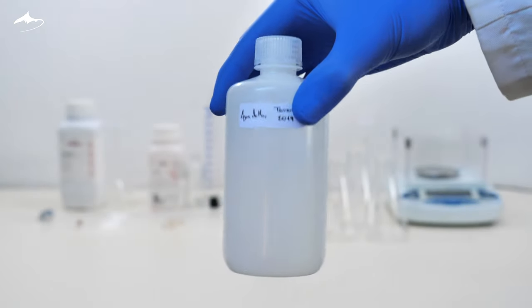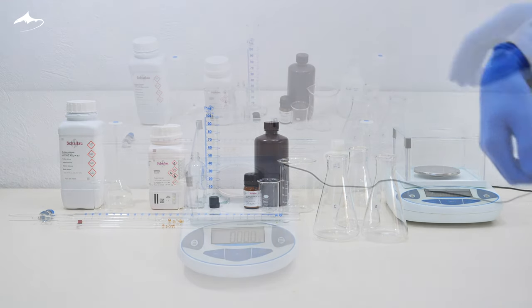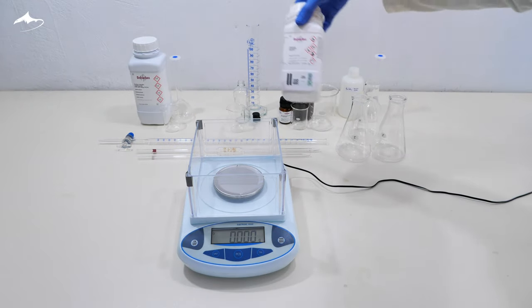Here are all the materials needed for the analysis. Let's prepare all the solutions needed for it. First, I prepare the indicator solution.